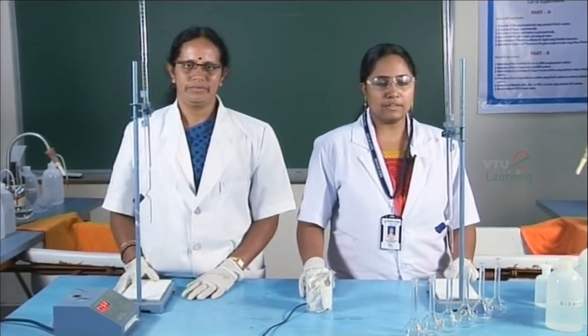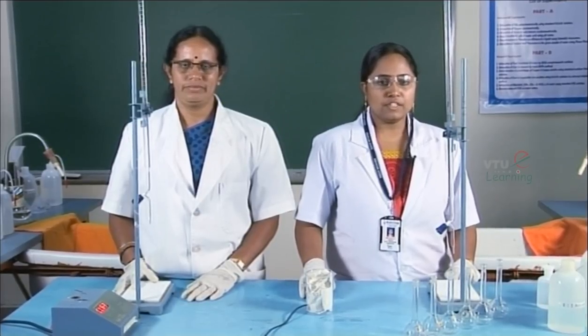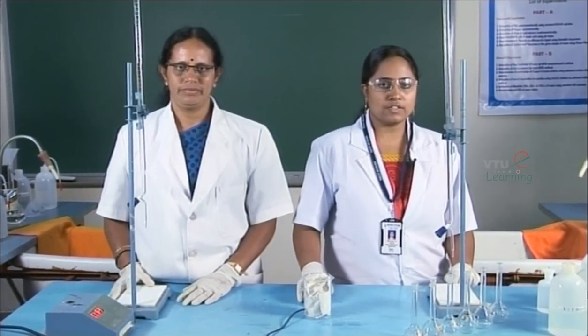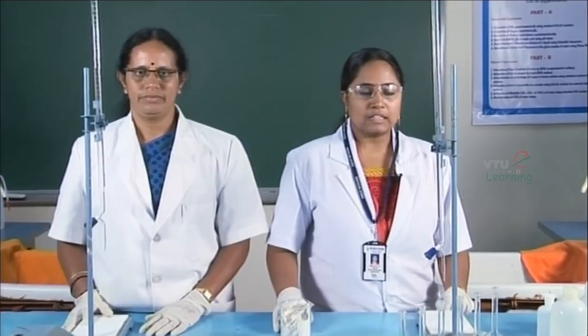Estimation of copper colorimetrically. Colorimetry is one of the spectroanalytical methods. The variation of the color of a solution with change in concentration of solute forms the basis of colorimetry. The color is either the inherent color of the analyte itself or due to the formation of a colored species by the addition of a suitable reagent.